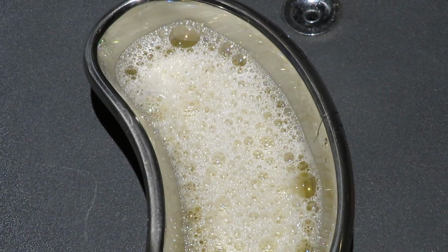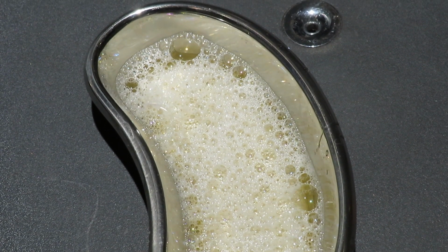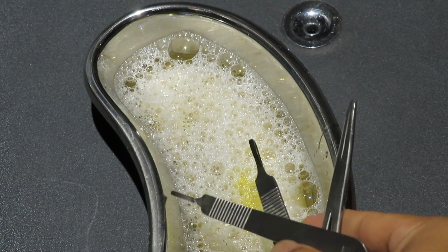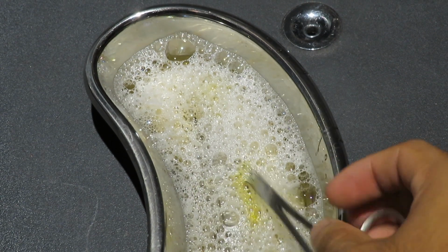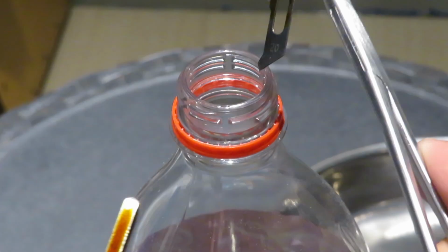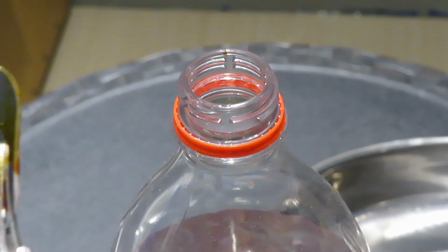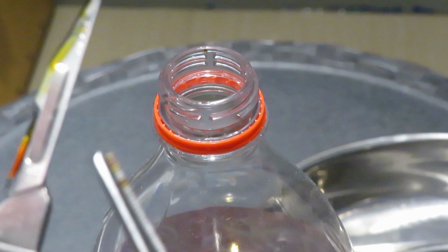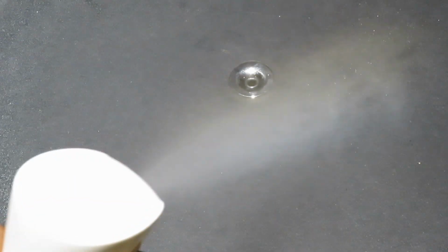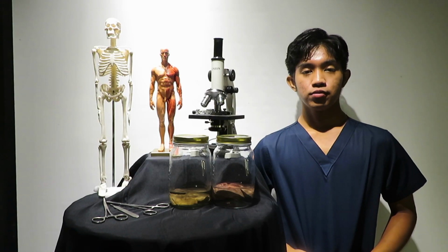Since there are visible droplets of blood on the dissecting equipment, I'll immediately soak it in hot soapy water and rinse it right after to properly disinfect. Let it dry to prevent these pieces of equipment from rusting. The used scalpel blade should be stored in this container with care and to be disposed of in the sharps collection bin. Lastly, I'll disinfect the whole place, especially the table, and wash my hands to execute the proper way of hand sanitation.